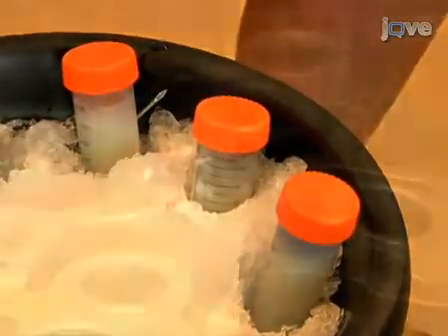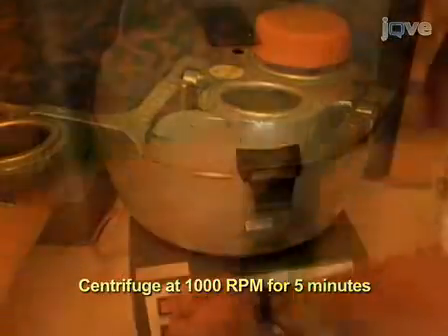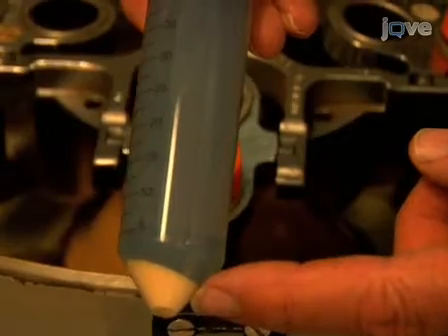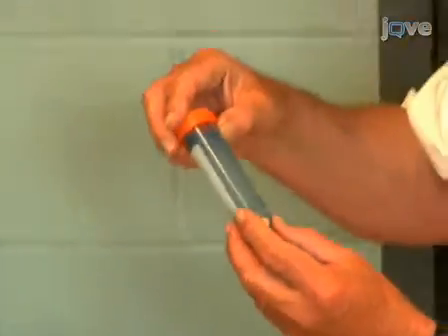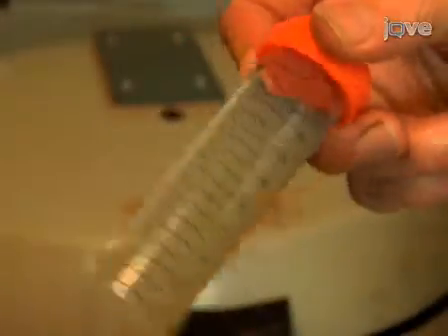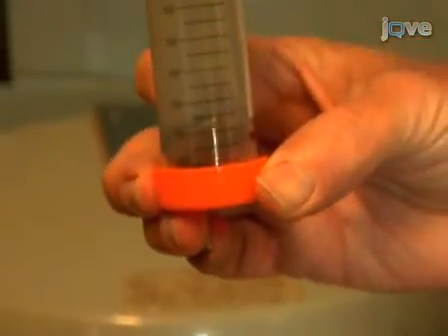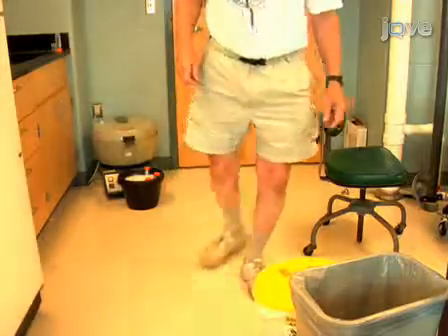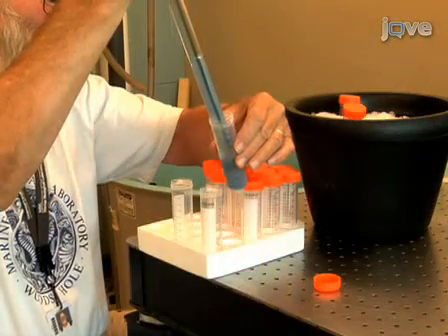As quickly as possible after the crab has been bled, recap the collection tubes and centrifuge at 1000 RPM for 5 minutes. This will pellet the blood cells at the bottom of the collection tubes. The blue fluid above the pellet is the plasma. Inspect the blood for gelatinous material attached to the walls of the tube, indicative of clotting, or large amounts of clot with entrapped blood cells in the fluid. The material from these tubes is serum, not plasma, and contains the secreted products of blood cells, whereas tubes of plasma are free of clots. Discard the serum-containing tubes and transfer the plasma to sterile tubes with sterile pipettes.